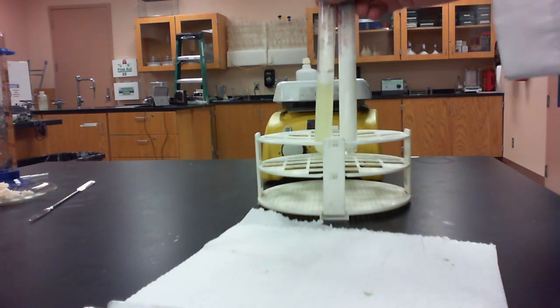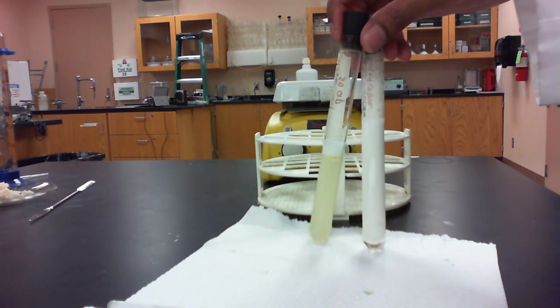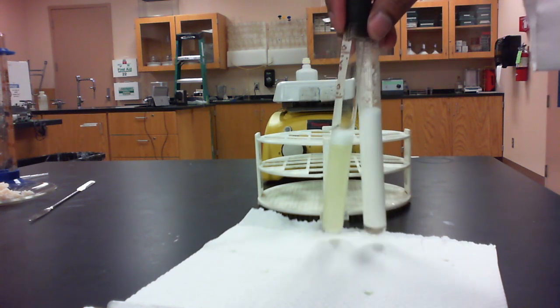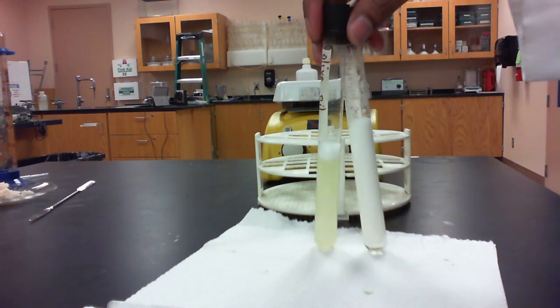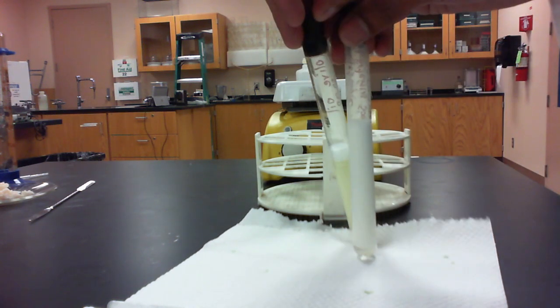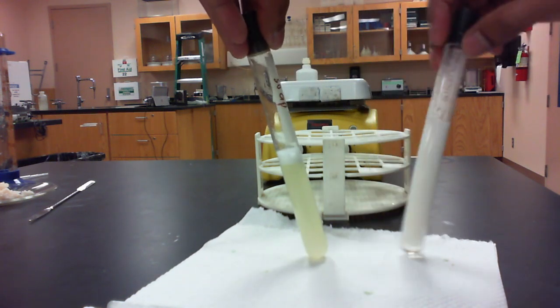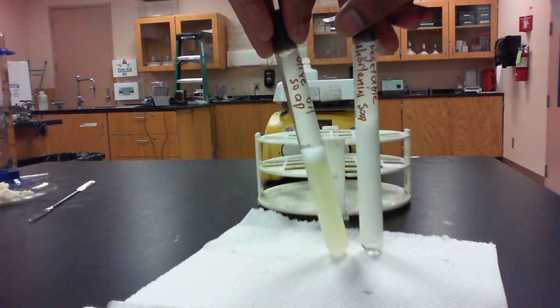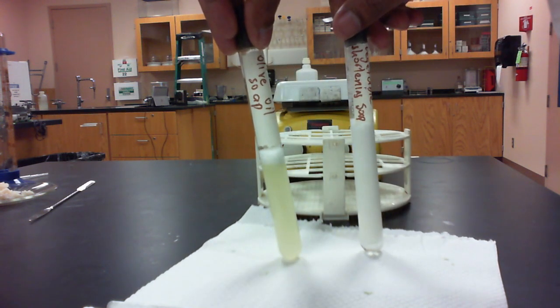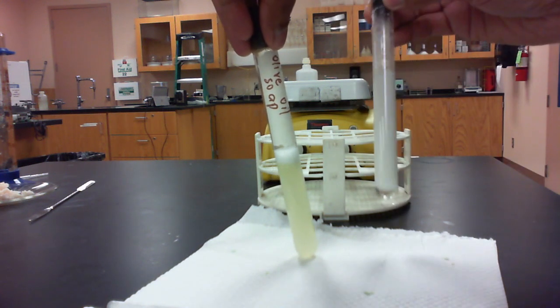Okay, so after shaking each of the soaps for about 10 seconds with 5 drops each of vegetable oil, we can make a comparison to see how much of the soap actually remains. So on the left side here, we have our soap made from olive oil, and you can see a little bit of the soap left over here at the interface. With the soap made from the vegetable shortening, it looks like it's mostly all just foam that's left over.